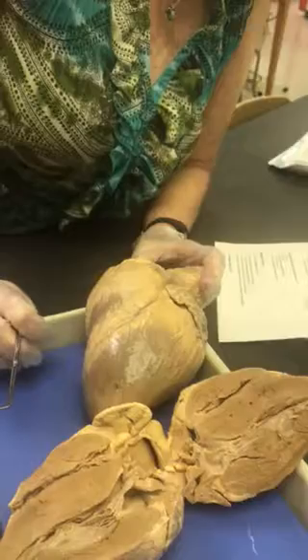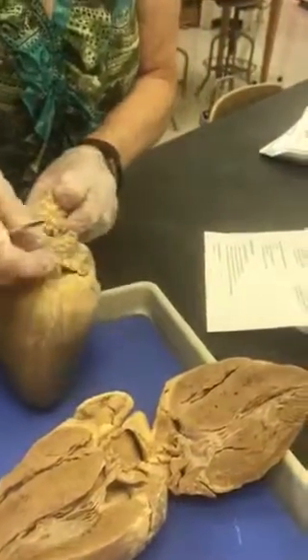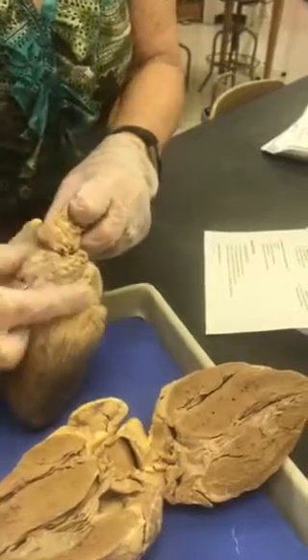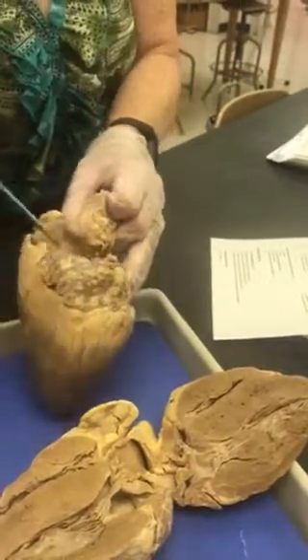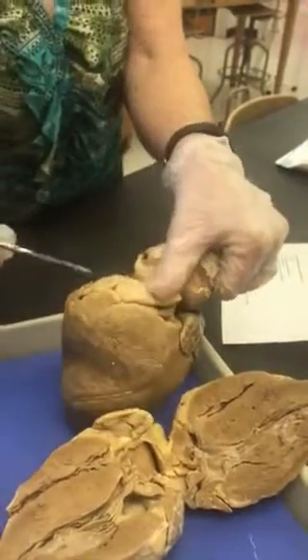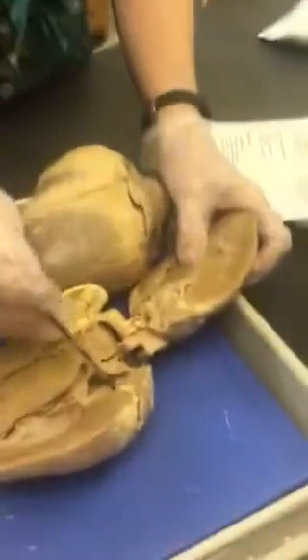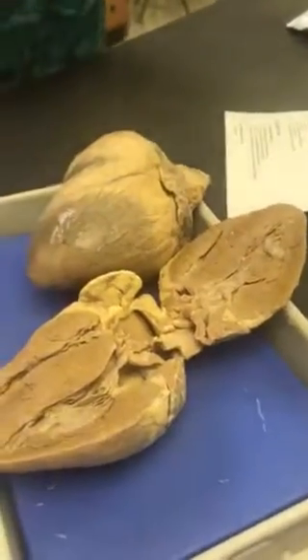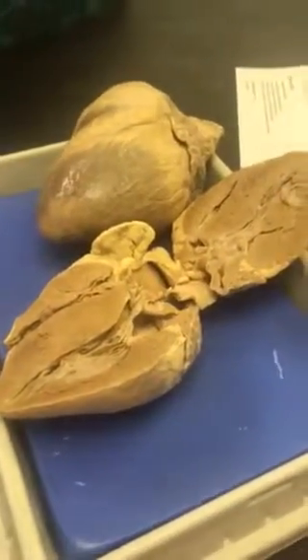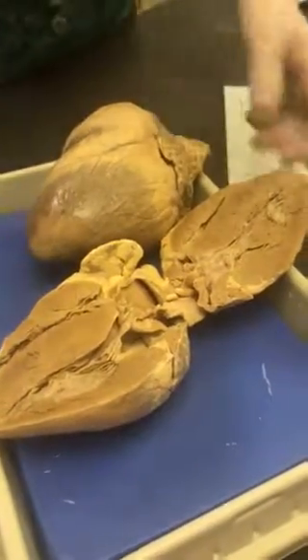Do you ask the auricles? I did not say the auricles. Okay, the flappy structure, the external part of the atria, is called the auricles. This is the left auricle, and this is the right auricle. Now the chamber is the atrium inside. Okay, so auricles, the outer part, the atria are inside. Okay, I think that's everything.